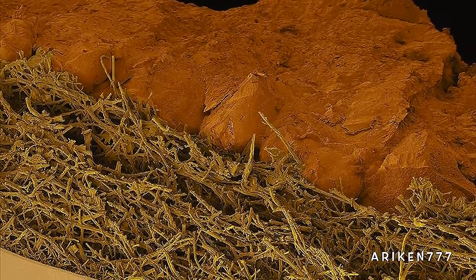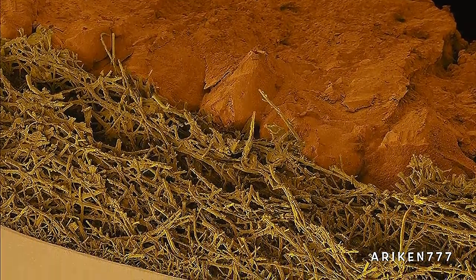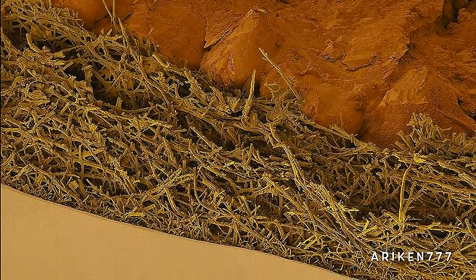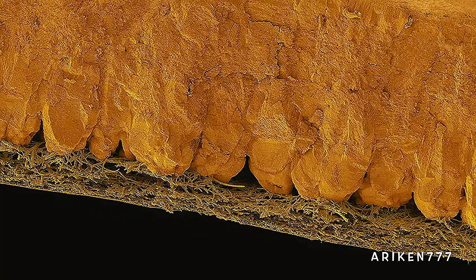A cross-section of a chicken eggshell shows the hard mineralized eggshell and the inner fibrous membrane. The hard mineralized eggshell contains calcium carbonate mineral crystals that form many tiny pores in the eggshell. The eggshell's inner fibrous membrane is composed of protein fibers.